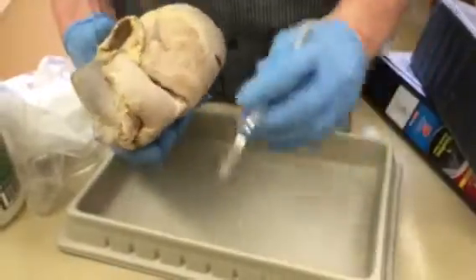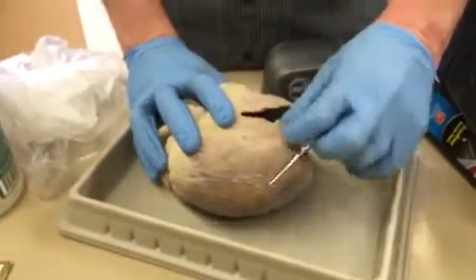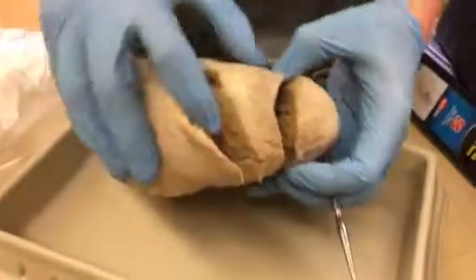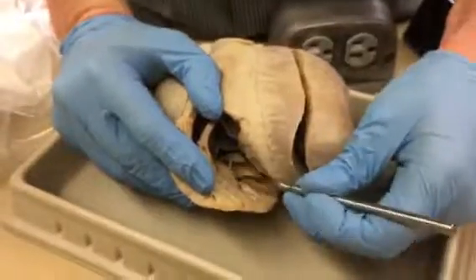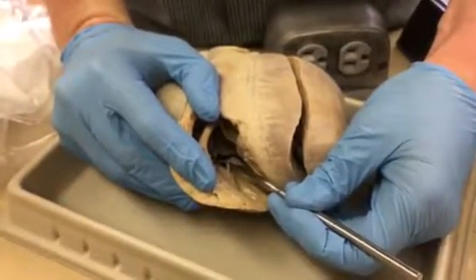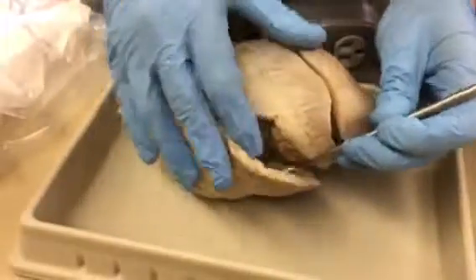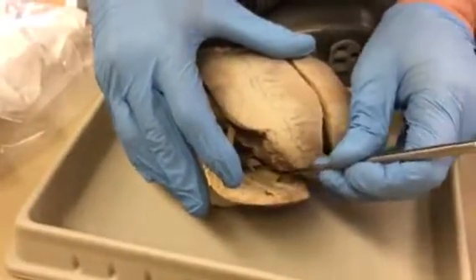In the ventricle, the interventricular septum is just the wall between. So this big thick wall. And then the papillary muscles, okay, so the way you want to know the difference, there's a bunch of bumps in here. A papillary muscle is something that has the tendinous cords of the flaps attached to it. So this big bump right here is a papillary muscle. But you'll notice that there's also other ridges, see, like that, that don't have a cord attached.